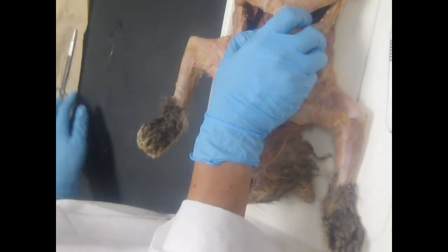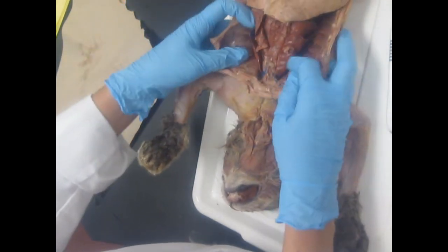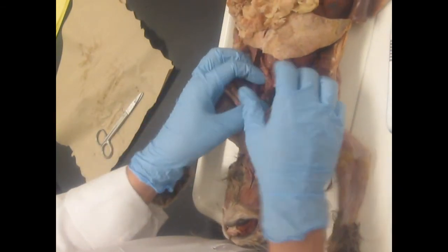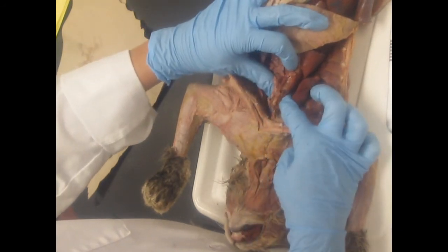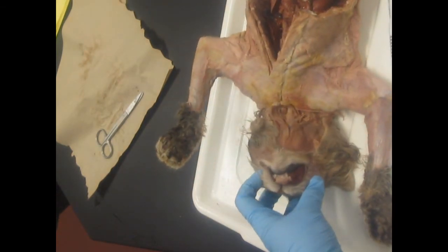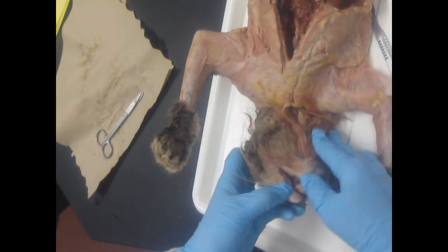Okay. Thymus. Thymus is going to be right over the heart, under where the sternum was. And depending on how old your cat is, you'll have more or less of it. This cat actually has quite a bit. This big glandular blob right here is thymus. Now you can tell if your cat's going to have a lot or a little bit of thymus because of how his teeth look. And if they're white and not broken, he's relatively young.